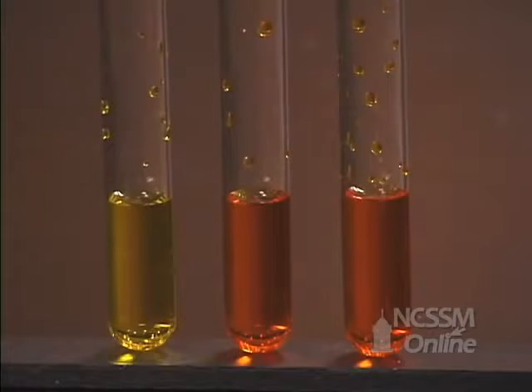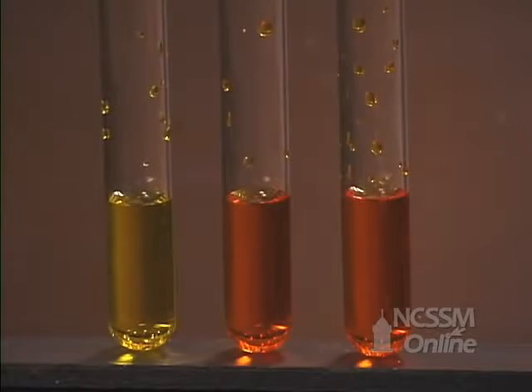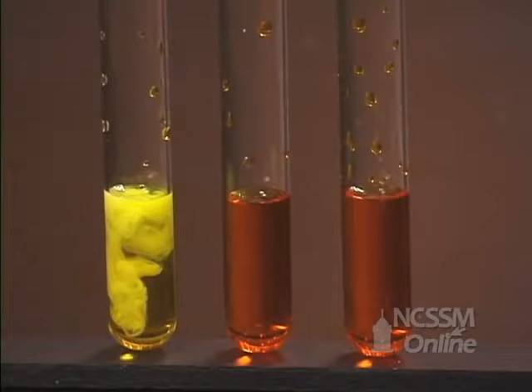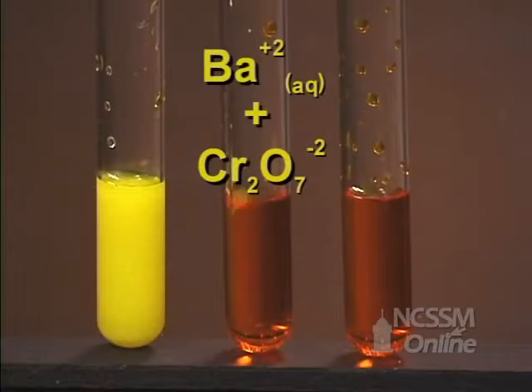We have 3 test tubes, one containing a solution of potassium chromate and 2 test tubes containing solutions of potassium dichromate. We're going to add a solution of 0.1 molar barium chloride to the first tube. We're going to add a solution of barium chloride to the second tube.